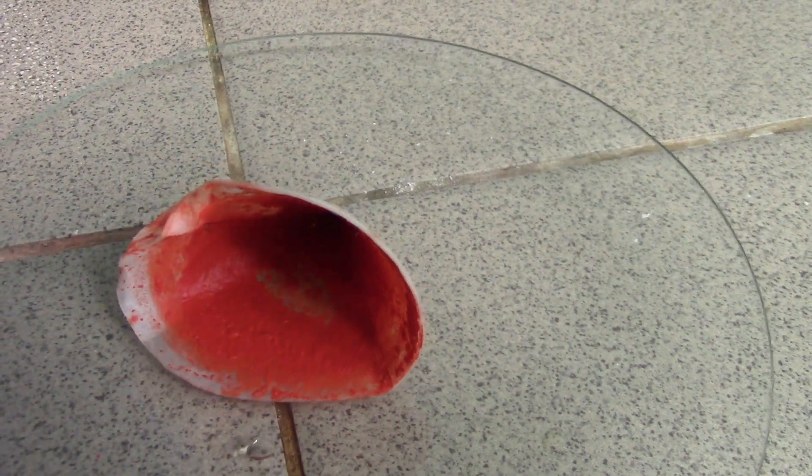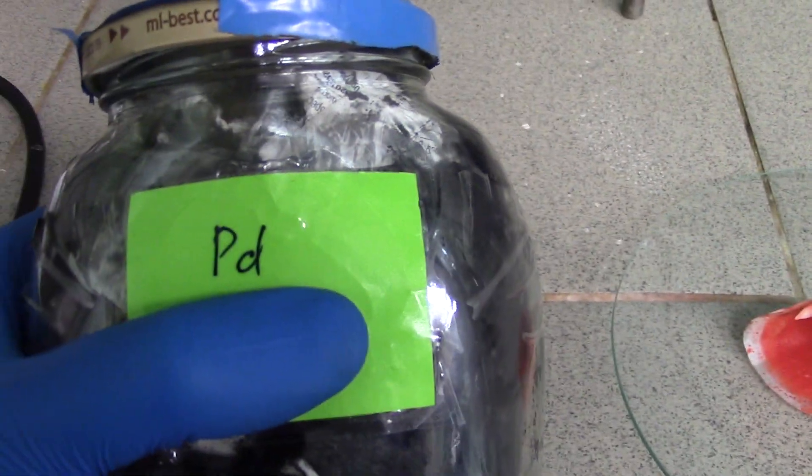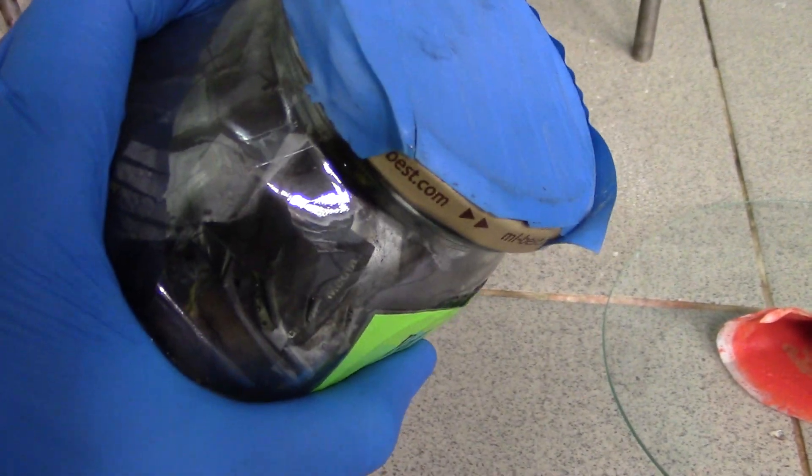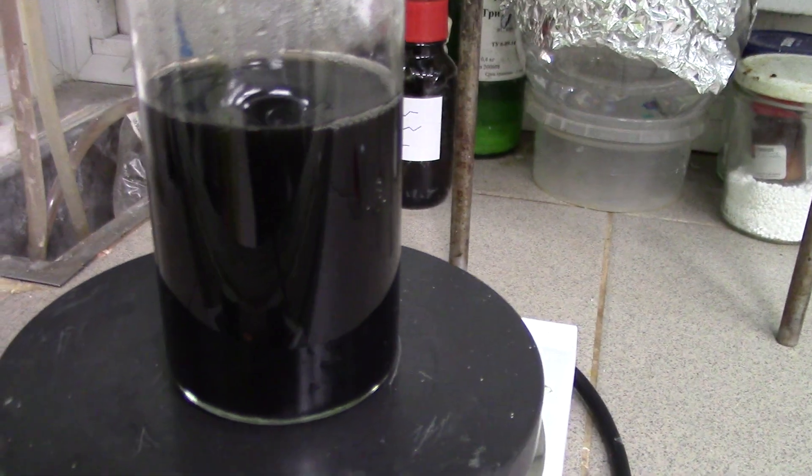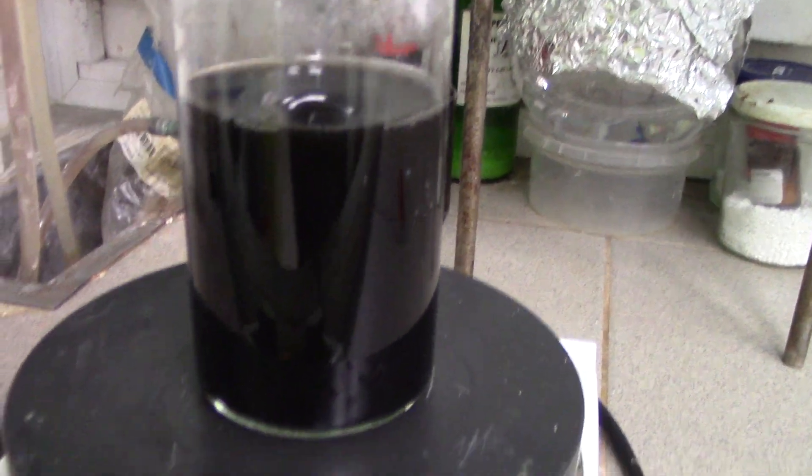In conclusion, I would like to say that we successfully recycled all palladium wastes and obtained potassium hexachloropalladate that can be used again in reactions or put into palladium waste container. The same goes for palladium black, which we managed to precipitate with tin chloride. Note, precipitation lasts around 4 hours for little amounts of metal. So freaking long.